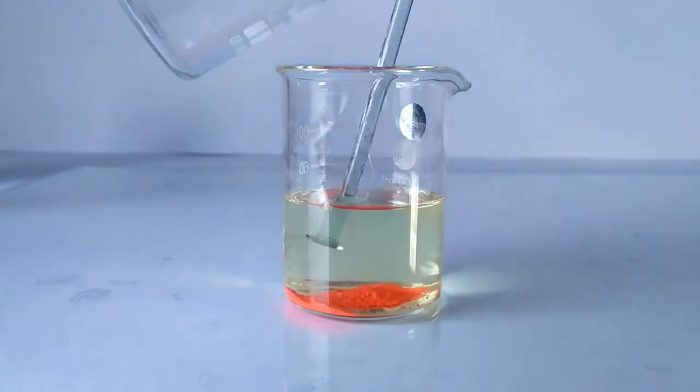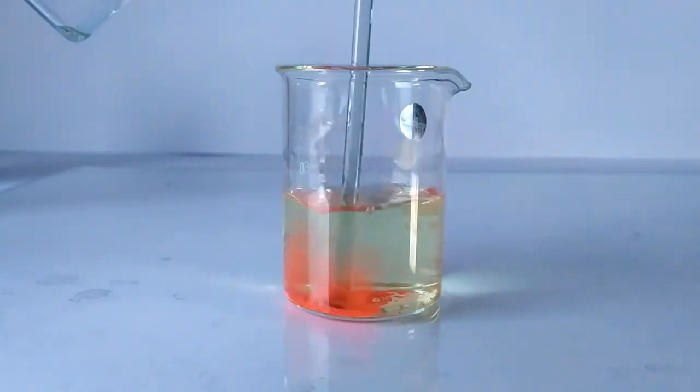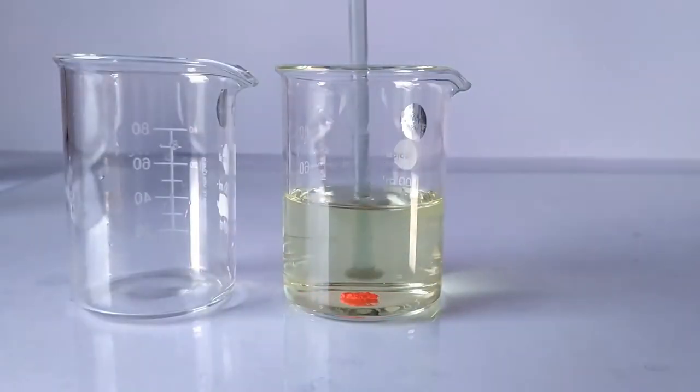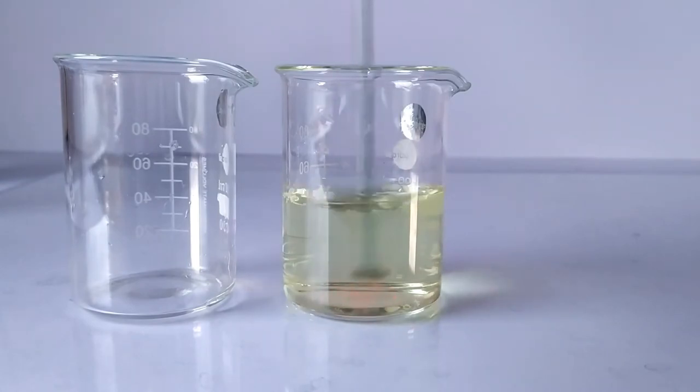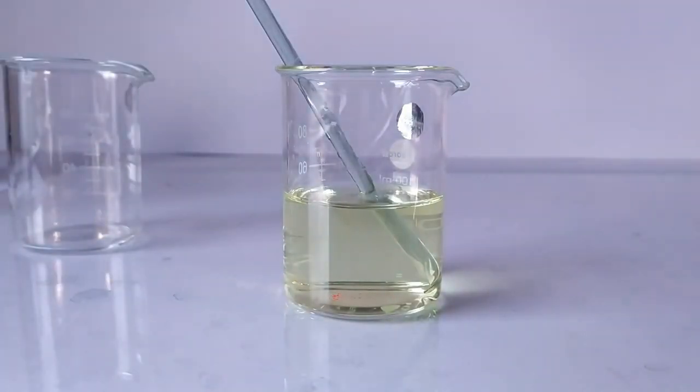Once all of the iodide solution has been added, the precipitate dissolves completely, leaving behind a pale yellow to yellow clear solution of the tetraiodomercurate complex.